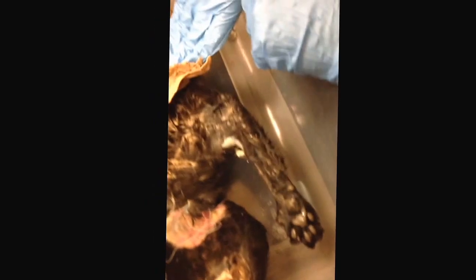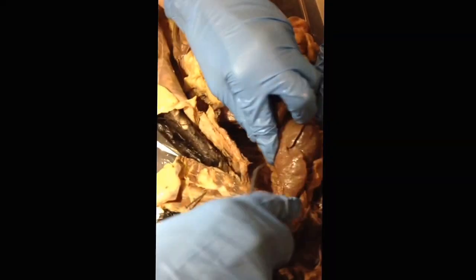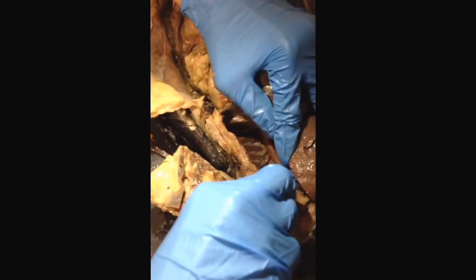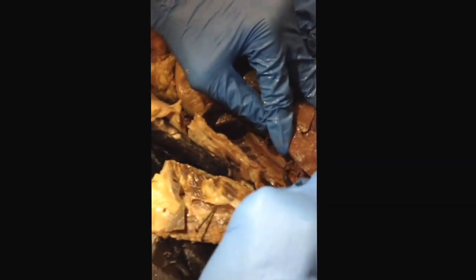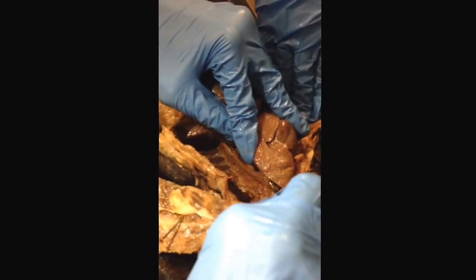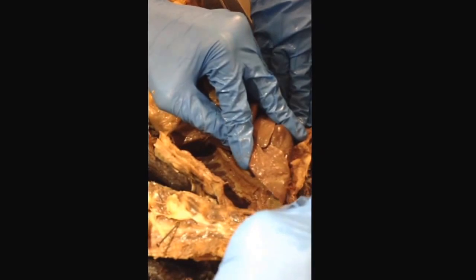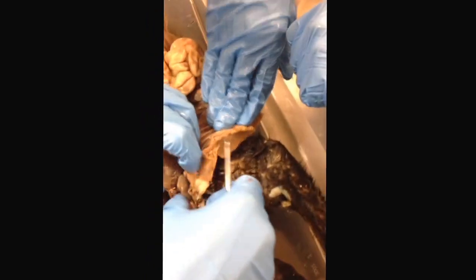Next thing on the list is the descending aorta. This is the major aorta. This is the major artery that gives blood to the rest of the organism, oxygenated blood, and this is found below the heart, and it connects with the aorta, I believe. The aorta connects to the... Is that correct, Stephen? It connects to the aortic arch. Yes. Okay, good.